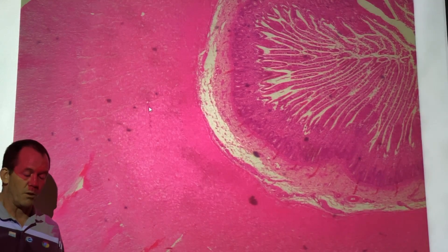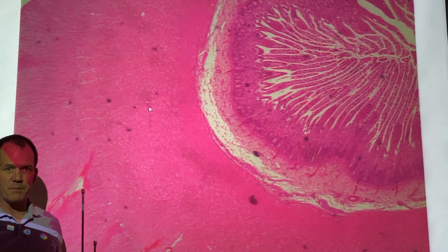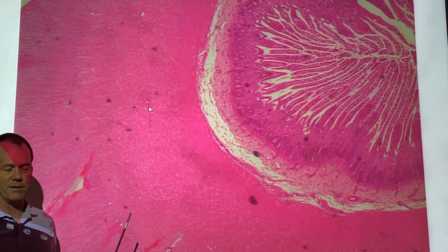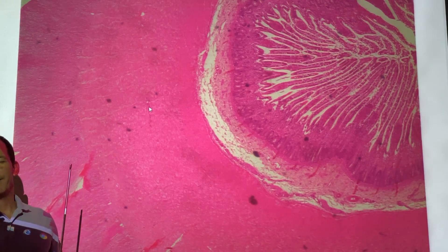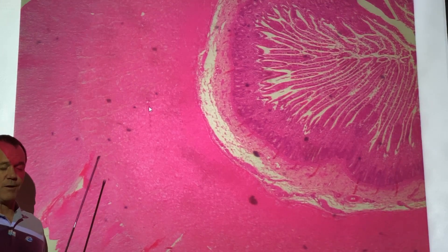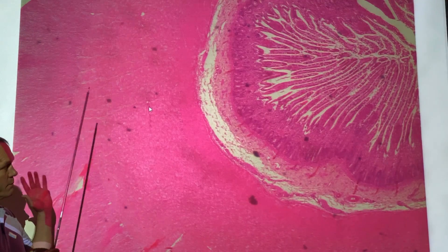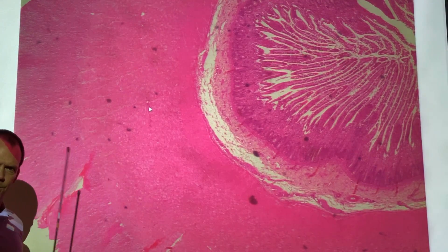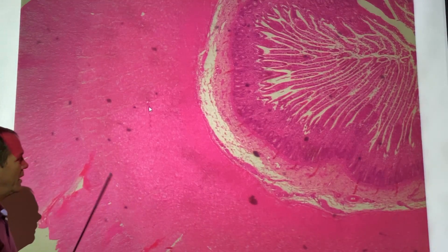I just covered the duodenum, and technically I should cover the jejunum next, which is the middle region of your small intestine. But it's nondescript, our slides aren't that great, and it has all the same layers as the duodenum and the ileum, but without any of the interesting stuff. So I'm skipping right to the ileum — we're not going to show you a jejunum on the test.